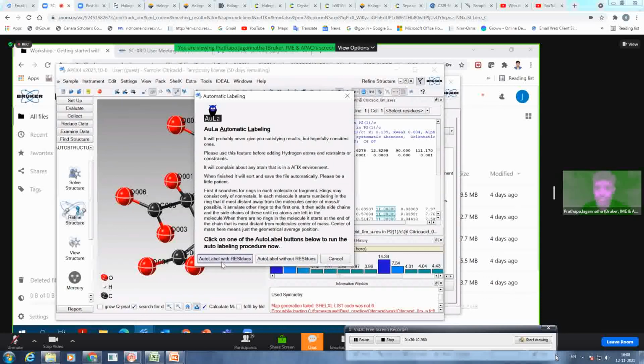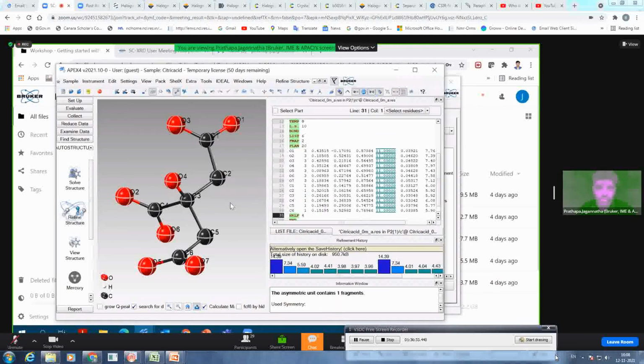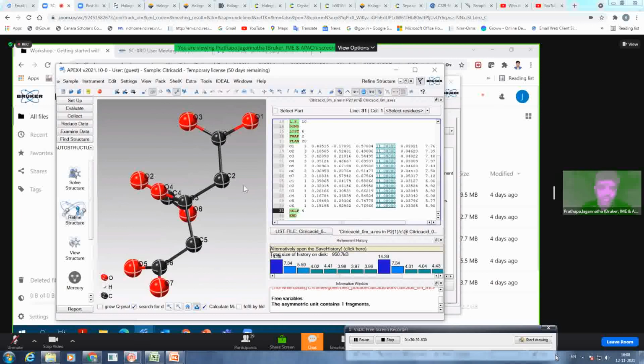With residues will help you if there are 2 or 3 molecules in the asymmetric unit and you want to have a constant or particular labeling for each residue. So you can do that, or in this case, without residues, I will do. It loads, it labels within a fraction of a second. So it added the labels and it also put my INS file in a very organized and proper way. So now it looks better.